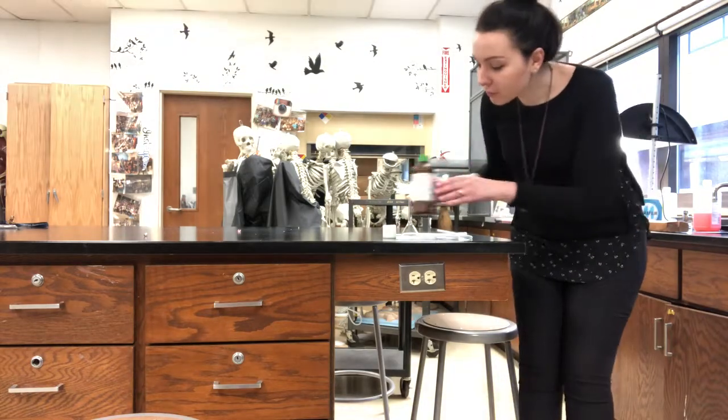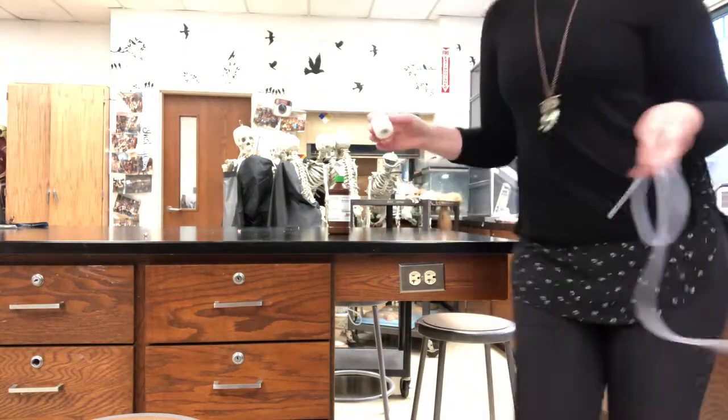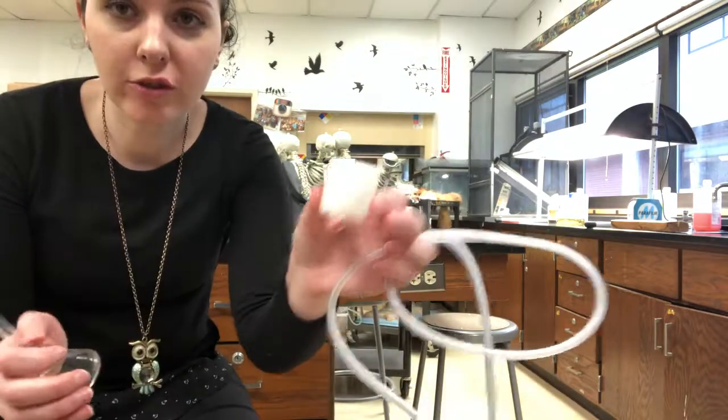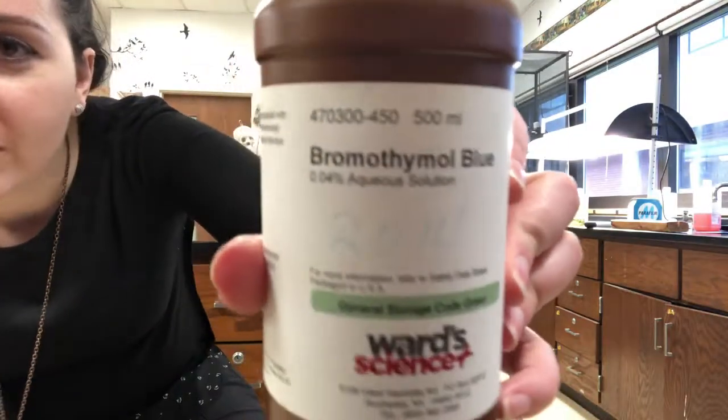So, for the algae farm, for the very first part, you're going to have to design a carbon dioxide capturing system using tubing, a candle, a funnel, and other lab materials. So how are you going to test to make sure that you're actually capturing carbon dioxide? I think I know the answer. It's bromothymol blue. So let's go to the lab and test out how it's able to see if there's carbon dioxide.